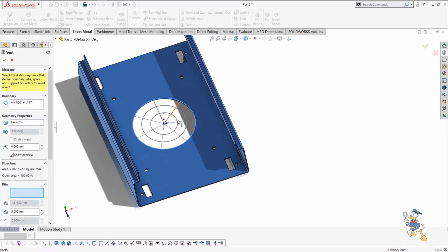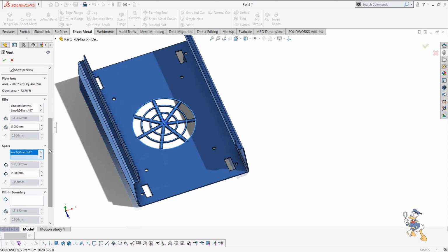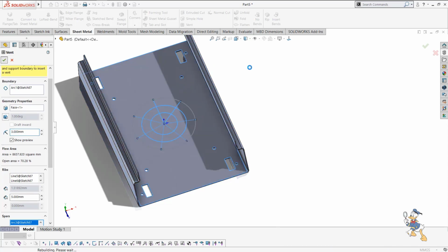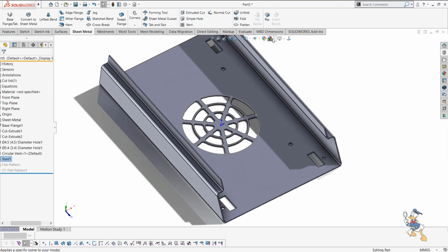We need to select some ribs over here. It is very easy to design a vent feature in SOLIDWORKS. We just need to select the ribs. We need to provide some spars. We can define the dimension of rib thickness and spar thickness as well. We need to provide some radius at these, and then we just need to click OK. And here we have generated a vent feature over here. So it is very easy to generate a vent feature.